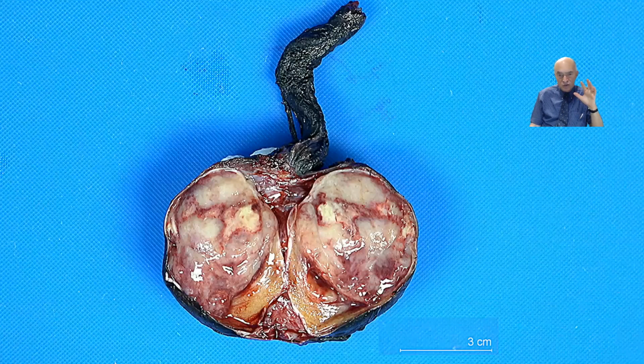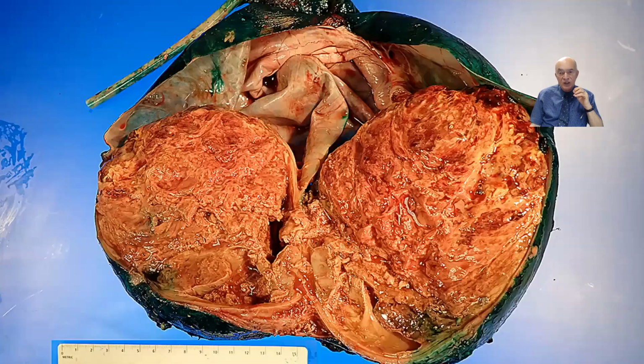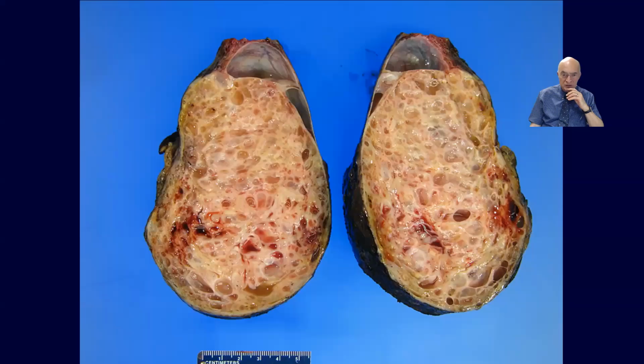So these kinds of tumors have to be very well sampled to give, in cases of a mixed germ cell tumor, a final assessment of the percentage of the different components of these tumors. This kind of tumor is very interesting because this has a completely different appearance as compared with a seminoma or a germ cell tumor. And this is a choriocarcinoma. This choriocarcinoma can also be accompanied by other parts of a mixed germ cell tumor, or be just pure choriocarcinoma. So we need to explore and take representative samples at different levels.